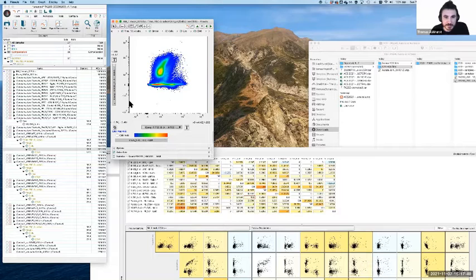Pretty much any time something is directly correlated between two different channels, something has gone wrong. Now that's not always the case. In T cell work, the actual TCR and CD3 correlate really strongly. If you have TCR alpha beta or gamma delta against CD3, it's more or less a straight line. It looks really weird, but that actually makes sense. Biologically, those two are perfectly correlated, whereas most of the time, things don't correlate one-to-one like that.